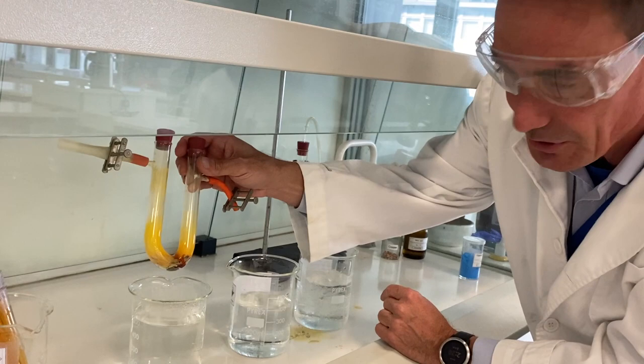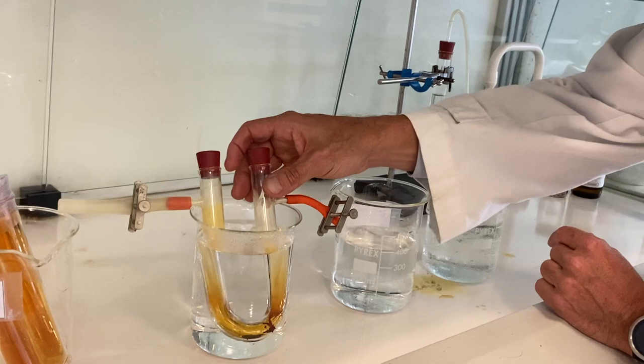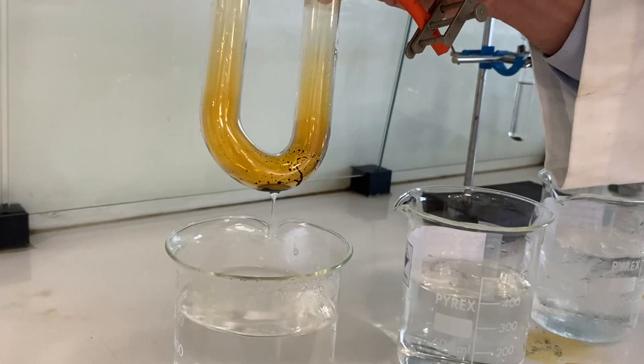So this is hot water, room temperature water, and clearly iced water. What happens if I put this in hot water, here we go, oh my word, what's happened to all the yellow stuff? It's all disappeared, look.